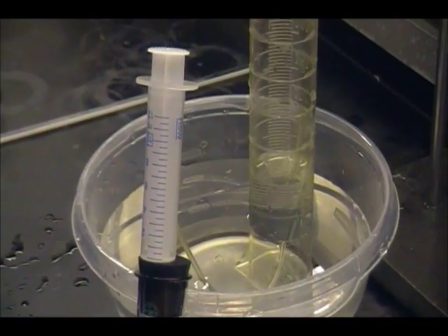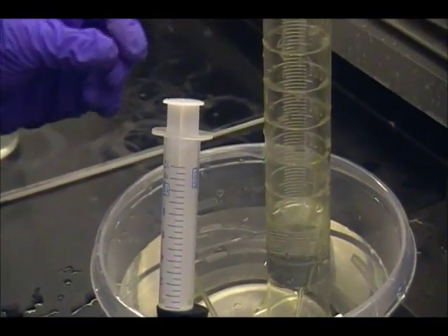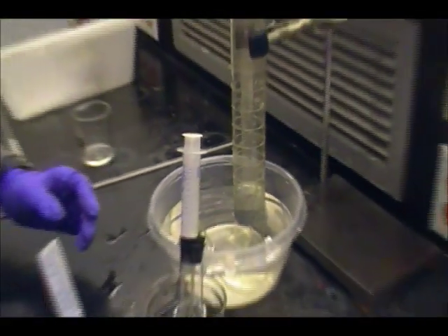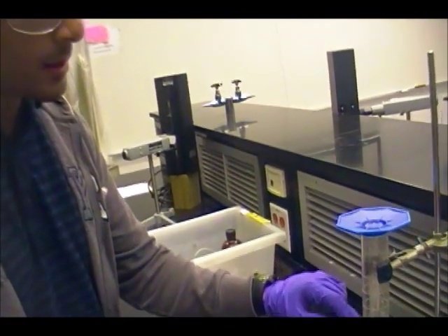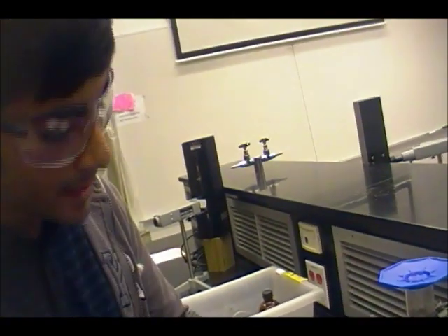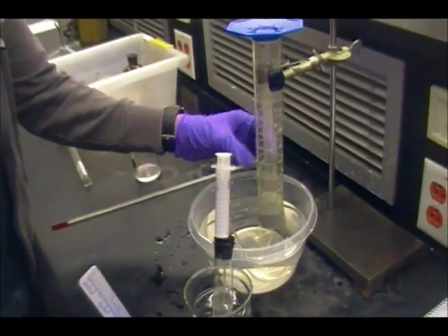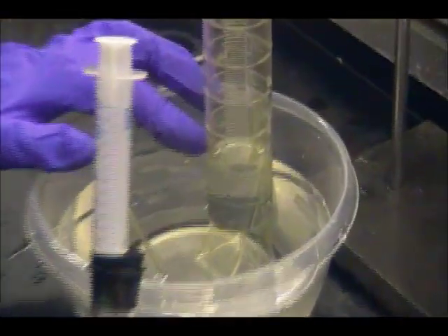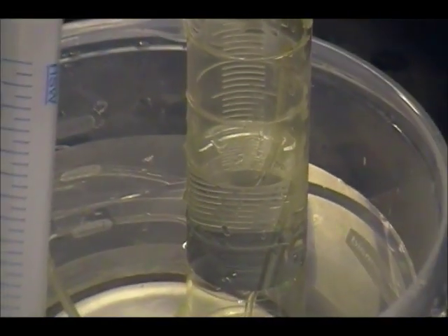Well, we have no device to measure the hydrogen gas's pressure directly, but what we will use is the barometric pressure, whose value is provided by your TA, and we'll compare that with the pressure in here with the hydrogen gas by comparing the water levels of the container and the graduated cylinder. Since the hydrogen gas hasn't pushed the water level all the way down to match the water level in the container, you can tell that the pressure of the hydrogen gas is less than the barometric pressure.